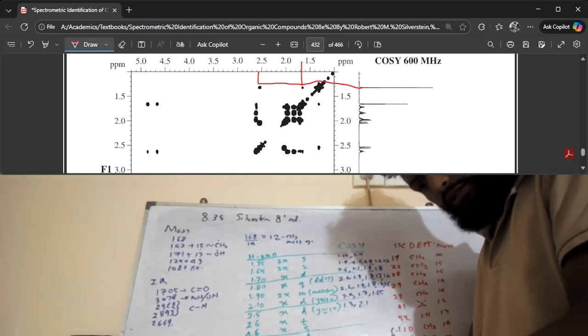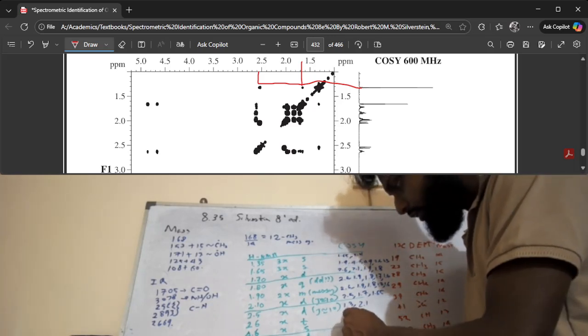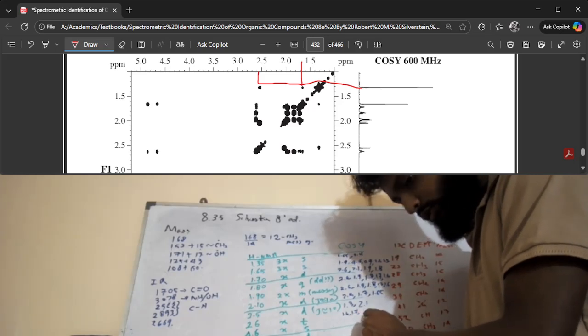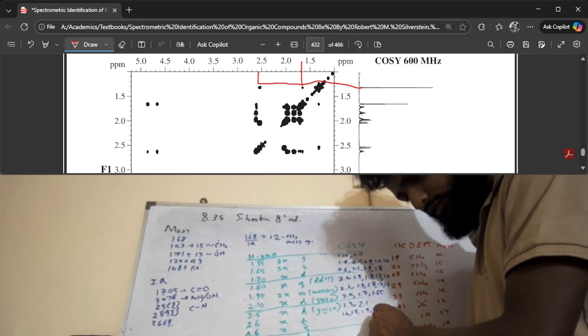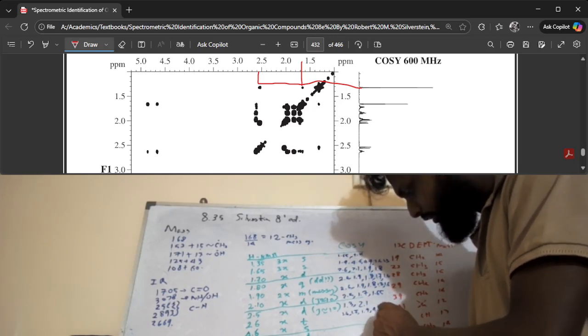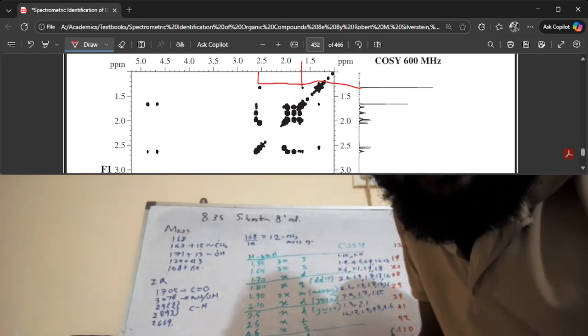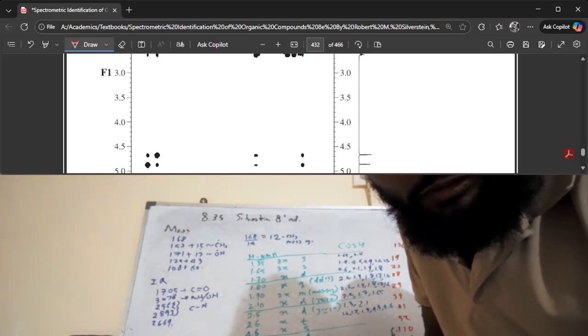The 2.61 is correlating with a bunch of stuff: 1.6, 1.7, 1.9, 4.7, 4.9, and then 4.6 as well. 4.6 and 4.9, if we look at them and see whether these are correlated, yes, they are very much correlated.